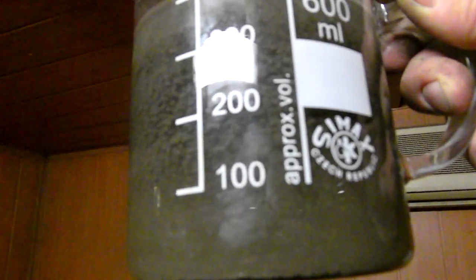There's some grey sludge slowly settling at the bottom of the beaker. What it is, and how I'll get the silver out of it, you can see in Part 2.